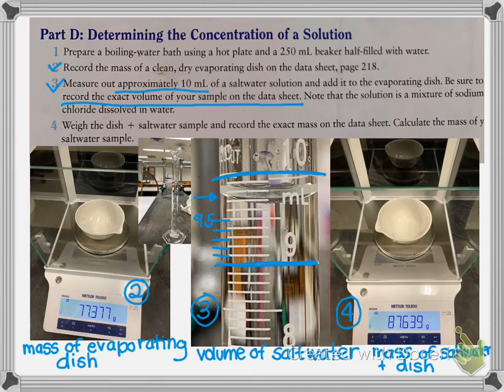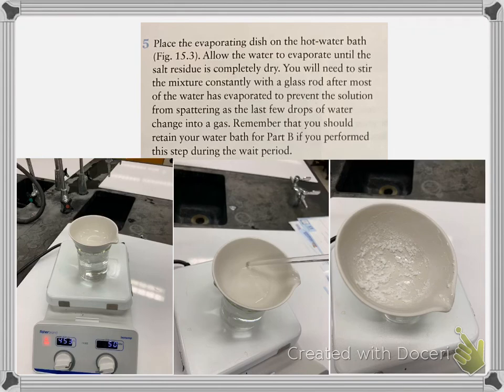Okay, so let's look at the next thing. Before I move this page, you should have written 3 bits of data down: the mass of the empty evaporating dish, the volume of your saltwater solution, and the mass of the saltwater solution and the dish. So then step 5, and this is kind of a waiting game. Here's my setup. This is step 5, and I just show you various stages.